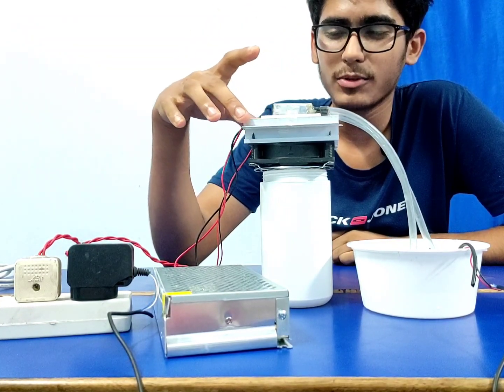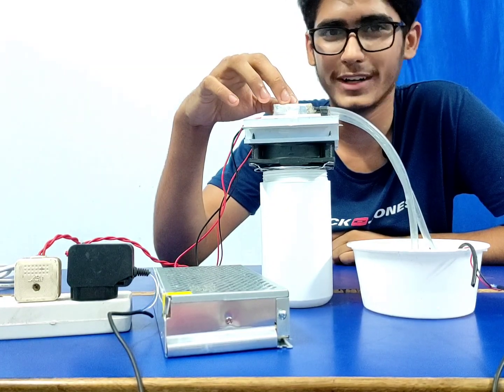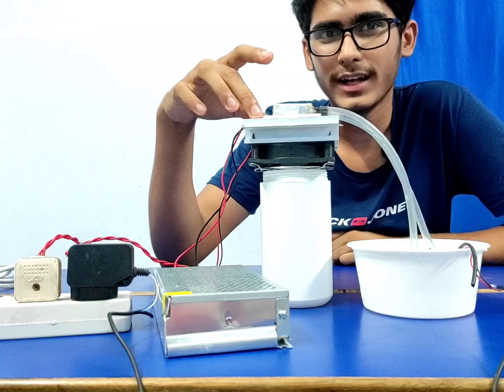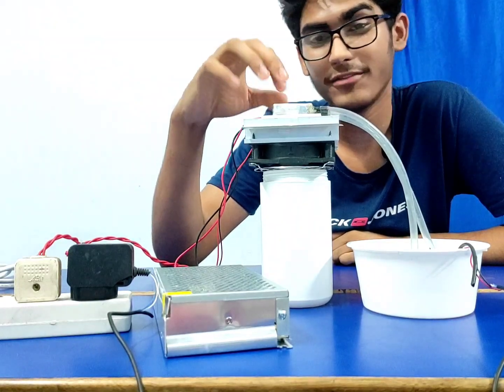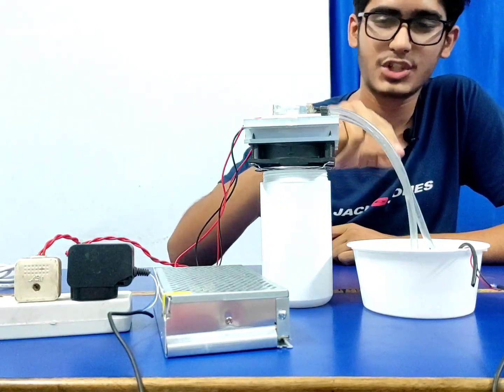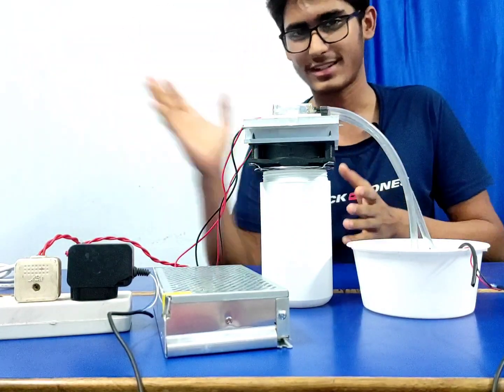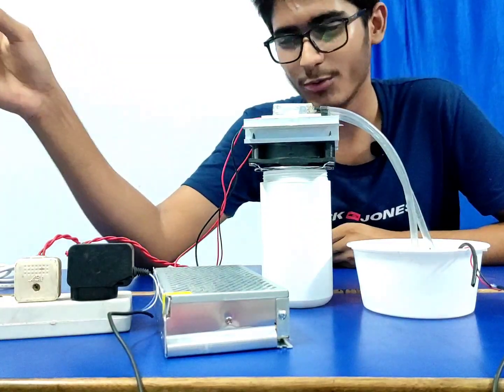It can cool up to 70 degrees, and here we get 10, 15 to 20 degrees, and I am trying to cool it at least up to 40 degrees. Then we will get very chilled water, like minus 14 degrees C. So I have to change this Peltier block also. That's a different thing. Let's come back to the video. I am just deviating. I'm into my own world.